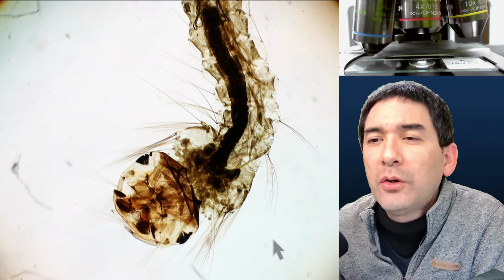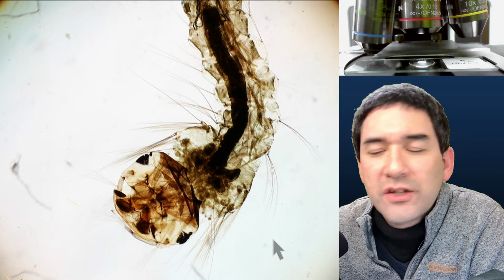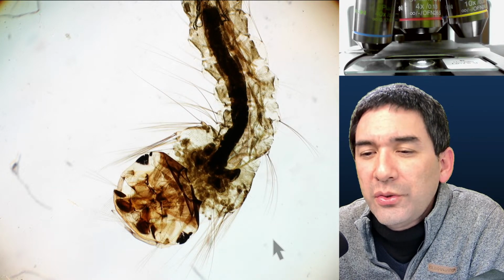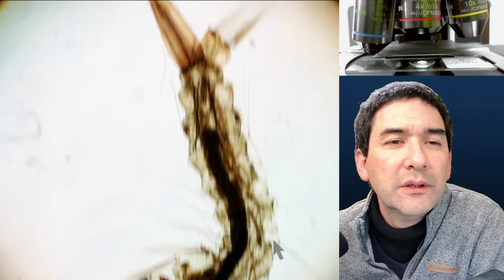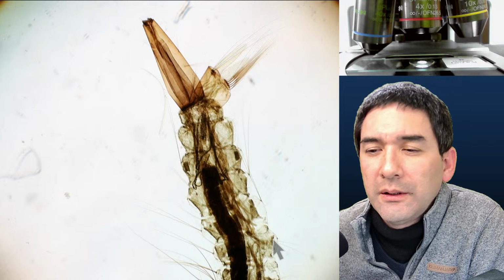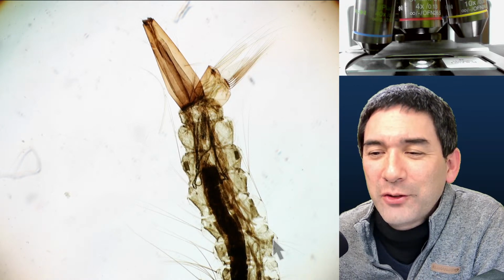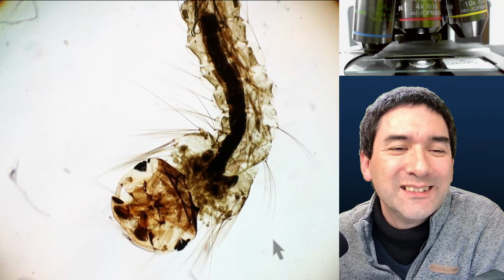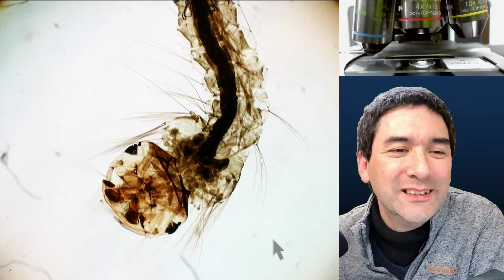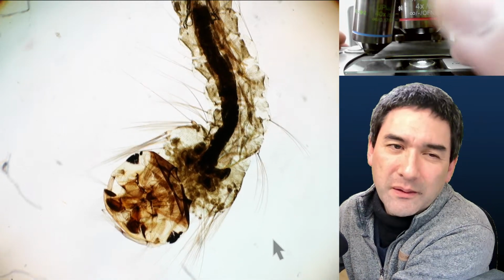So let me quickly go through over here. What are those elongated structures? I don't know what you are exactly referring to. A live mosquito larvae scared the heck out of me when I was viewing a drop of pond water in my microscope. Yep. Okay, let's go to the next one.